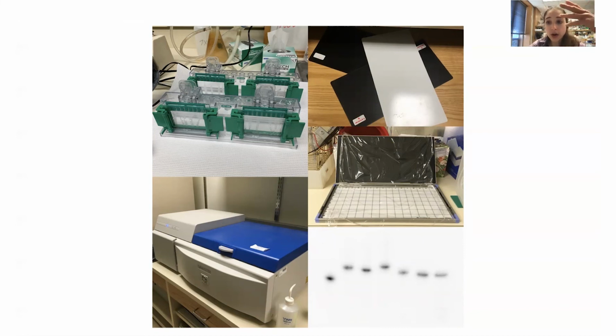But that's on average. This decay is a random process, so you can't predict exactly when it's going to happen. You can't just say, okay, everybody hold off. Okay, now decay. Instead, what you can do is take that decay and store it.